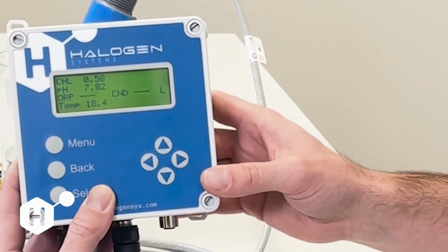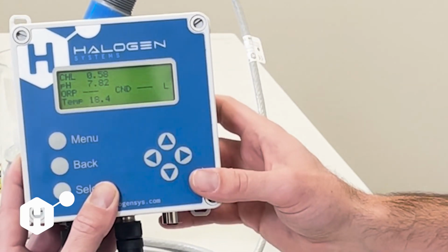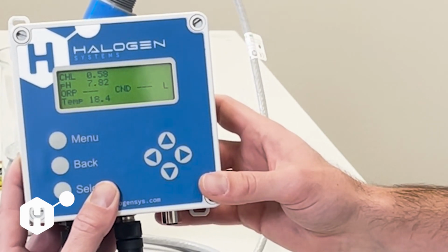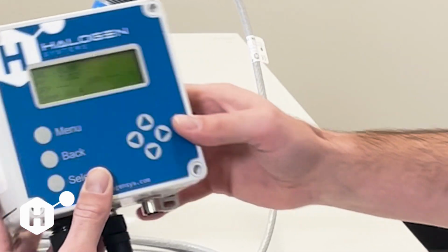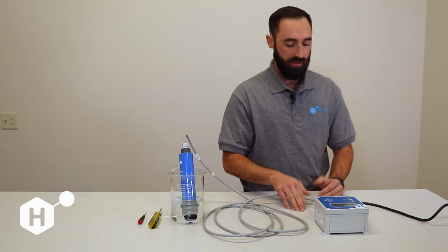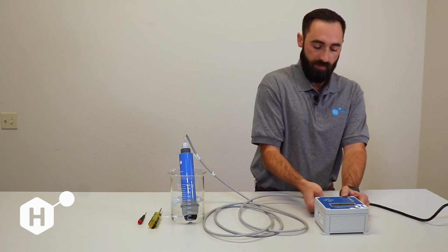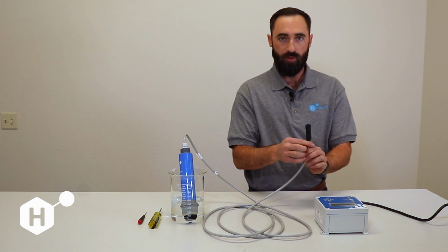Next, I'll show you one of the ways to do it like you would with a ballast water sensor. Say you went and did that and you still weren't able to communicate with the sensor. Then the next step is going to be to rule out some communications or hardwire connection issues. So at this point, I would disconnect my sensor, and I'm going to remove this M12 connector.